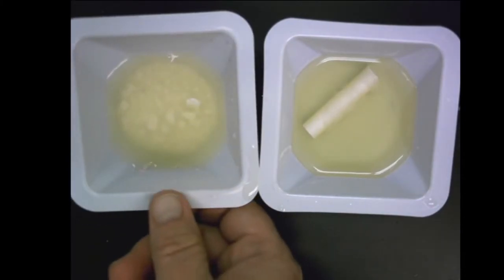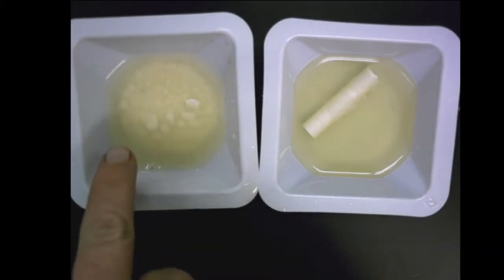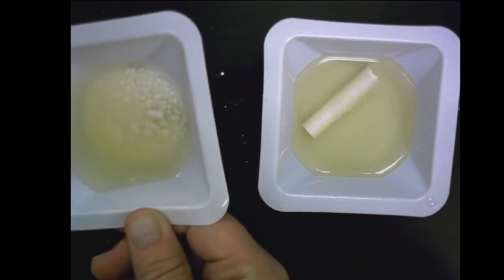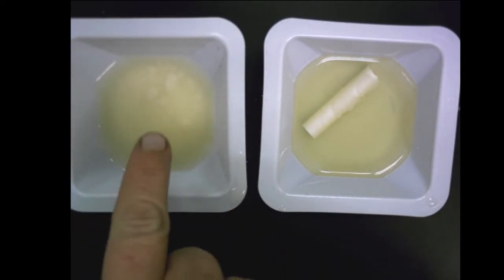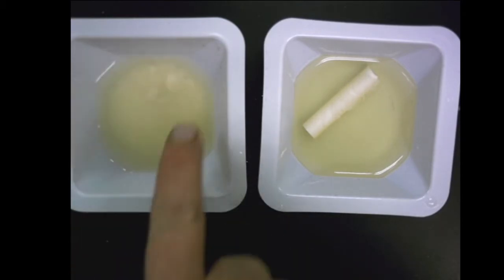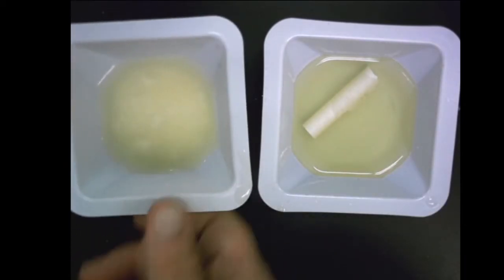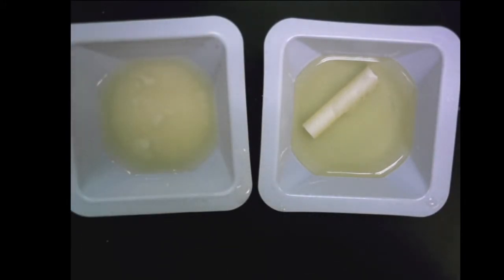I'm going to swirl it around so it gets to the bottom. You can see a lot of different reactions happening here. There's lots more reaction happening over here. The chalk is definitely dissolving a whole lot more when I stir it, because that's one of the things that makes the rate of reaction go faster, right? You can see it foaming up because the reaction is just on the surface here, but it has more contact over here with the chalk. So we can increase that reaction by a lot.